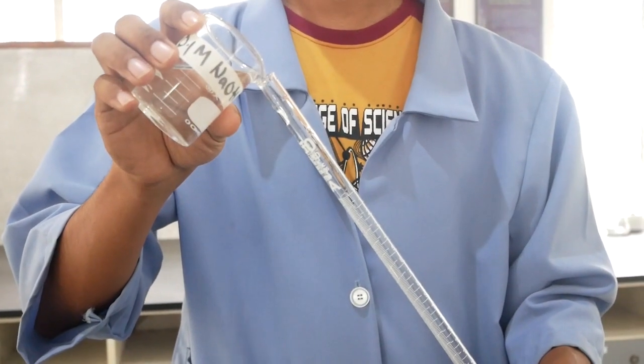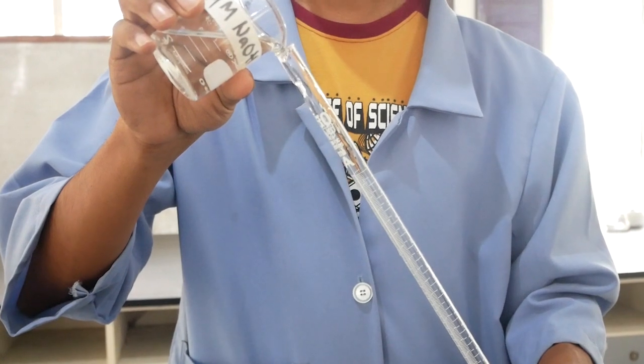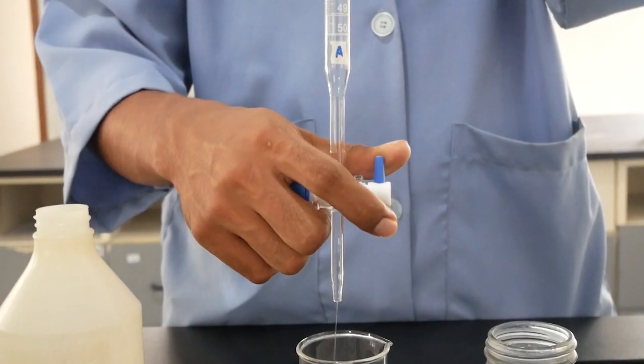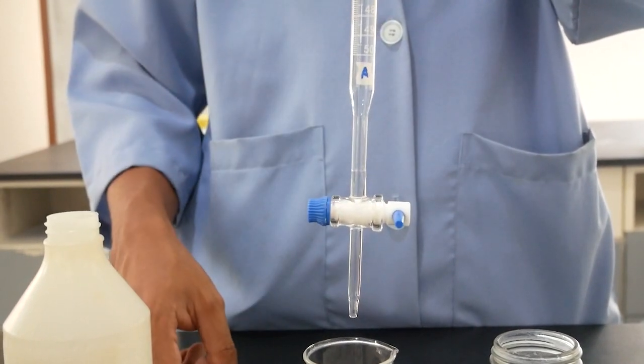Now, we are ready to fill up the burette with the rest of the titrant we used in rinsing it off. Momentarily open the stopcock to let the titrant fill the bottom part of the burette.